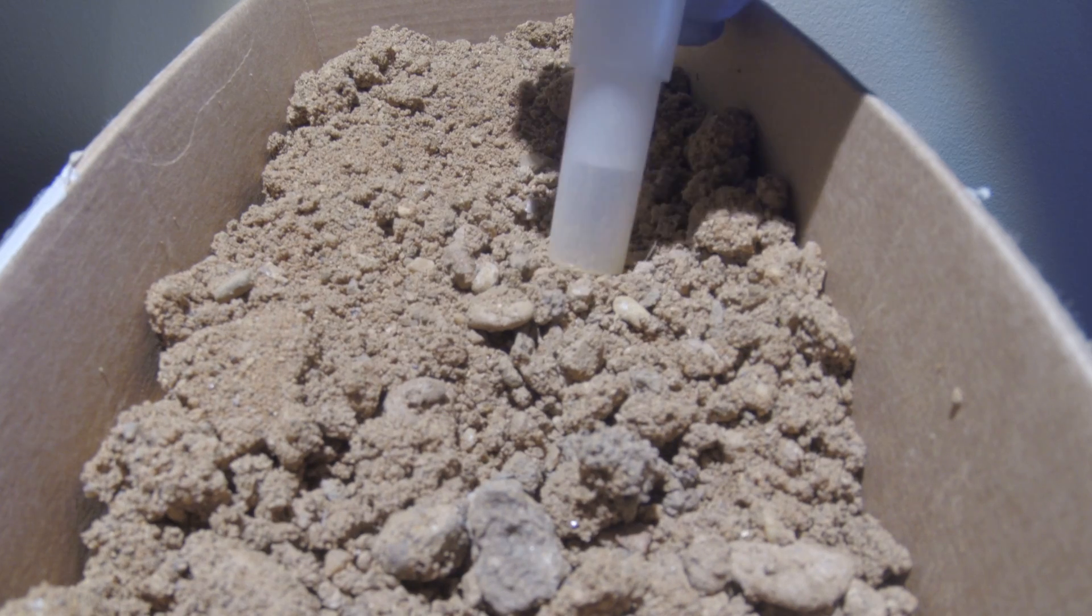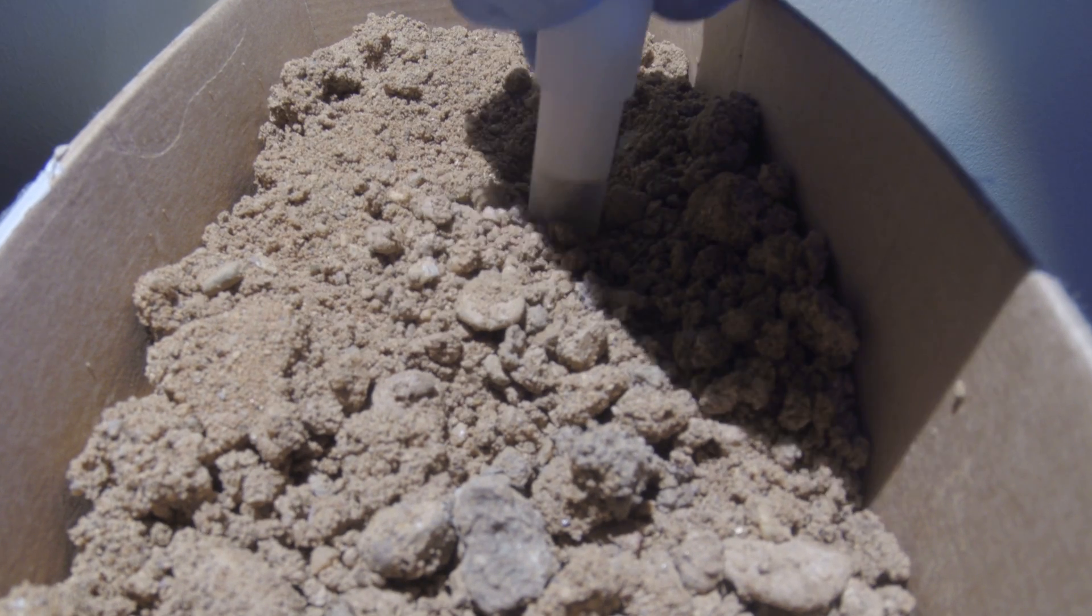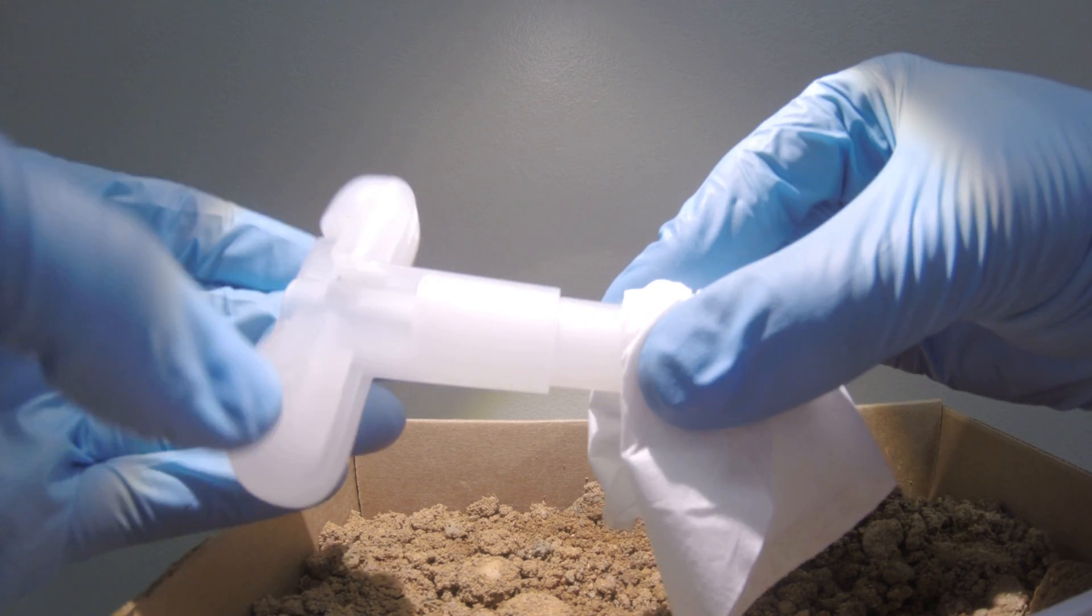When you are ready to sample, simply press the sampler into freshly exposed soil, then wipe excess soil from the sampler.